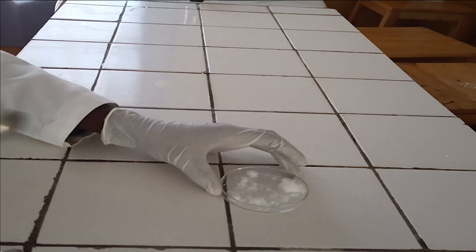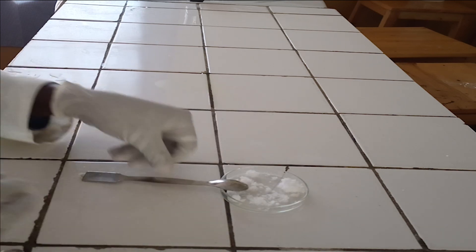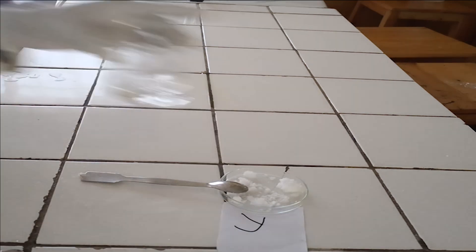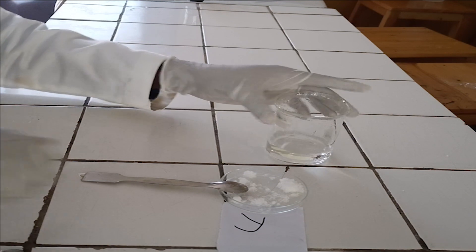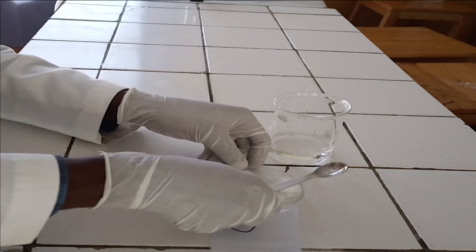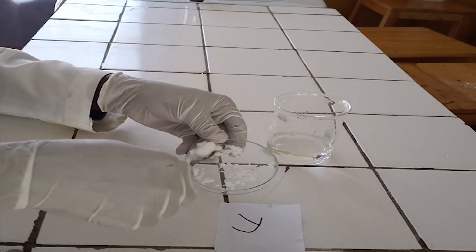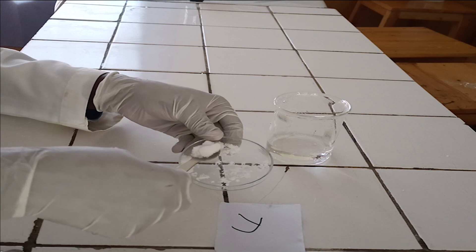Test for magnesium ion. Preliminary tests. First step is observation. Salts of magnesium ion are white.